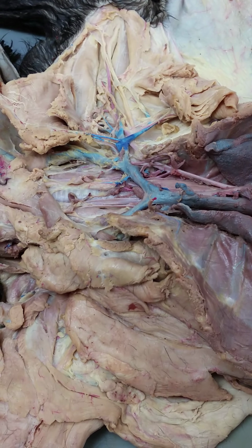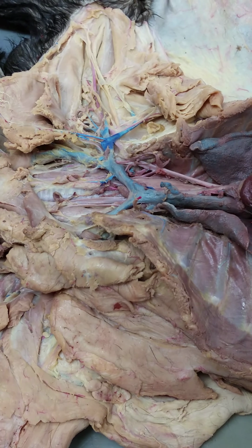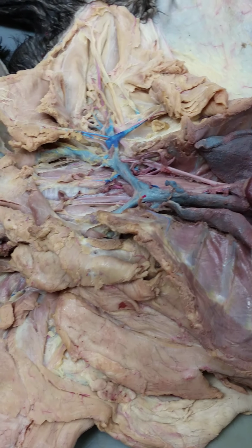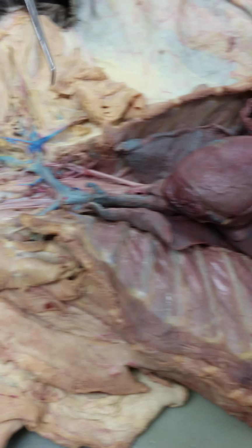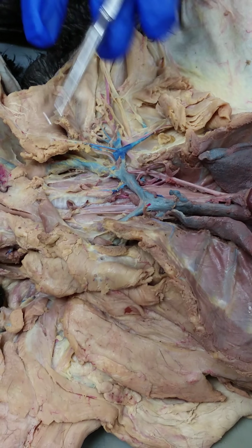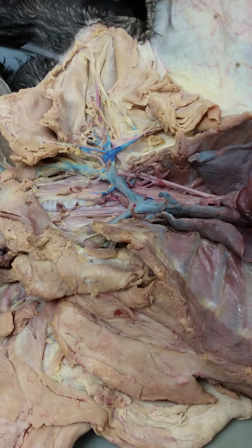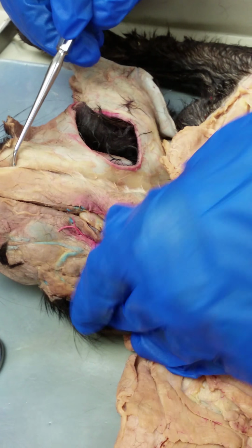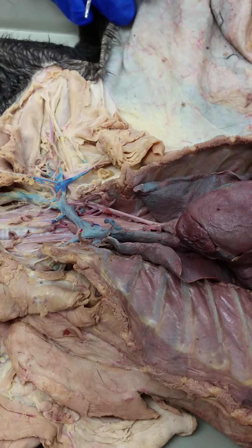Okay, so there's a lot of new names, right? New terms. You probably only have actually heard of the aortic arch, the jugular, and the carotid before today, right? Maybe you heard of the brachial artery, like running down the arm. Okay, so this gets us started, right? We're ahead of the curve. This is the hardest area really to clean out and look at all the smaller arteries. So when we come back Wednesday, we're going to follow this external jugular up the side of the face here and do some of those branches, and then we can also do some of the ones in the abdominal pelvis.